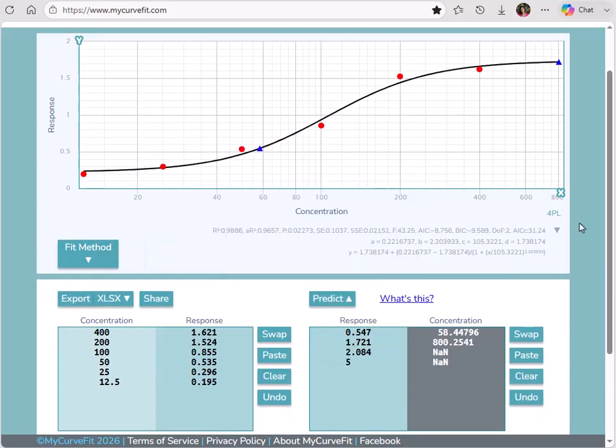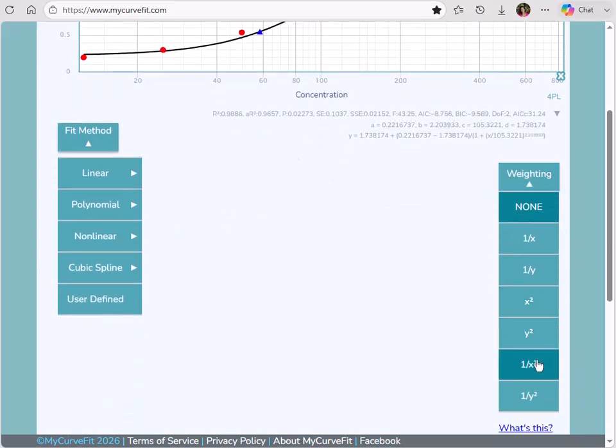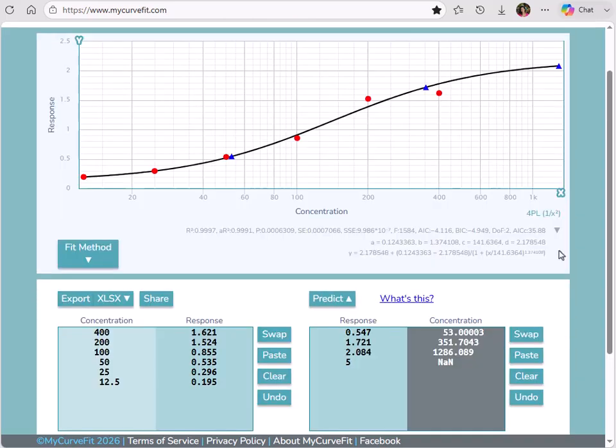You'll recall that with no weighting applied, the third prediction point could not be extrapolated as the value is outside the curve limits. Our first response interpolates a concentration of 58.448, and our second response extrapolates a concentration of 800.25. Let's apply a weighting model, 1 over x squared.